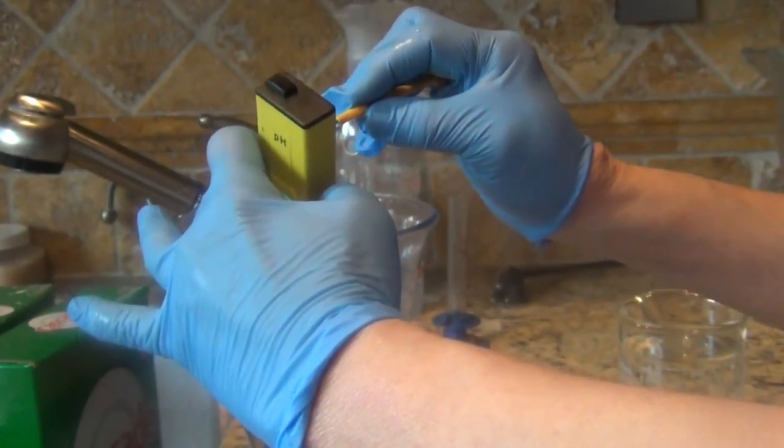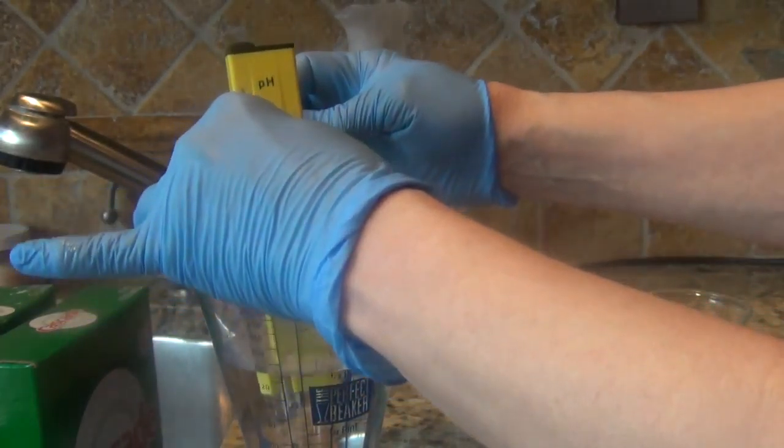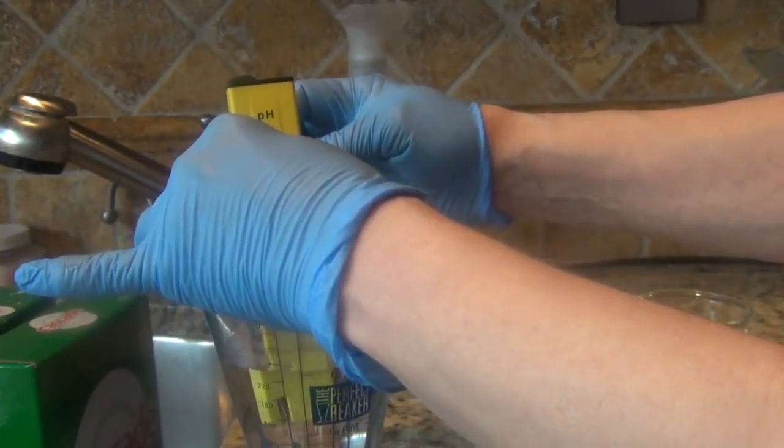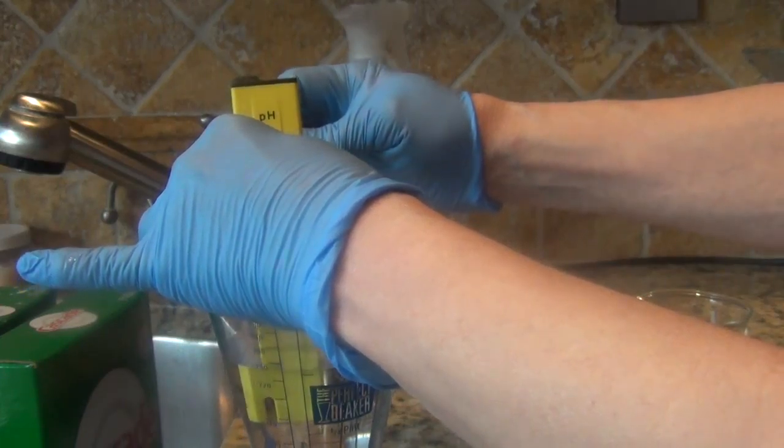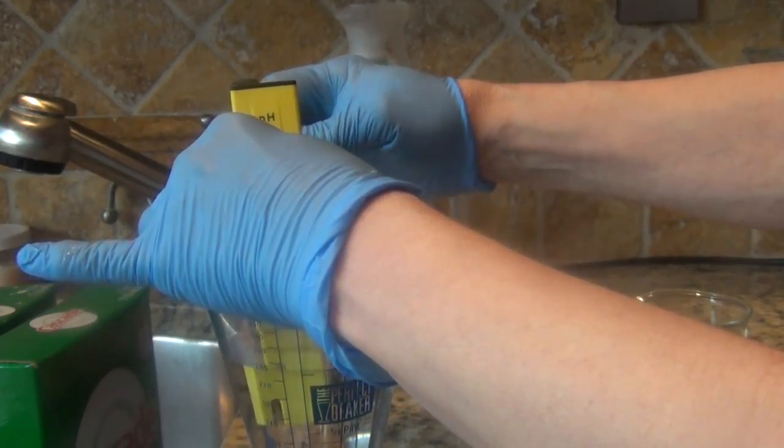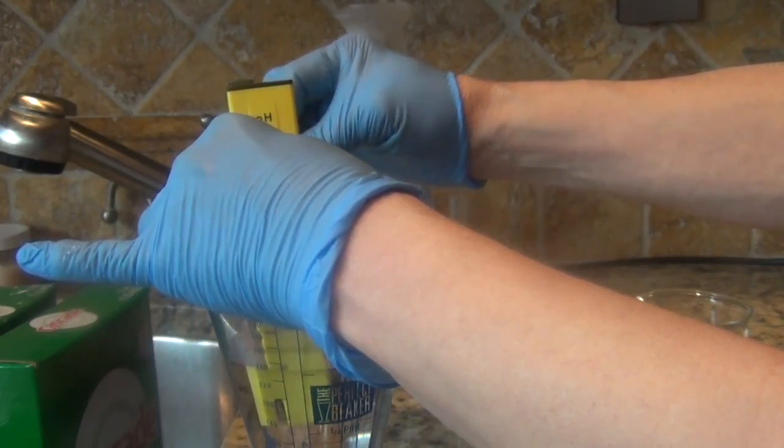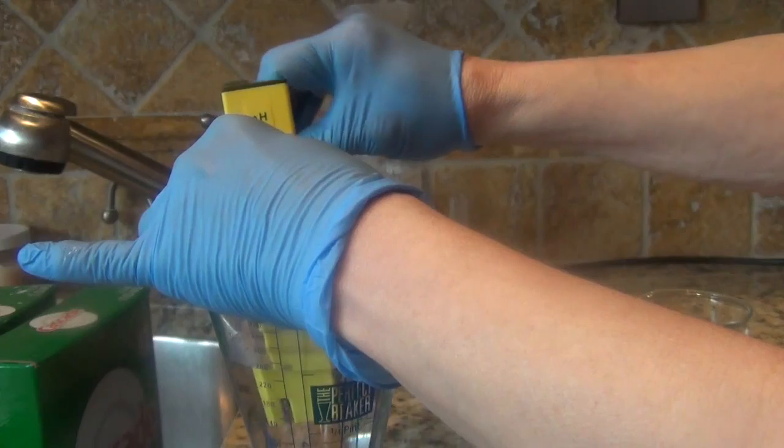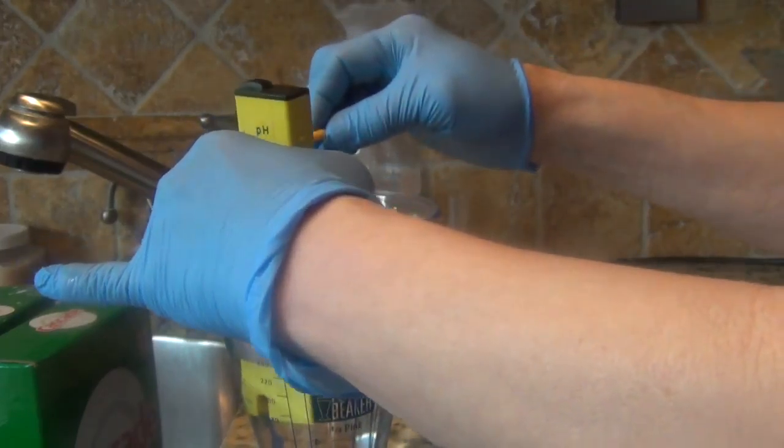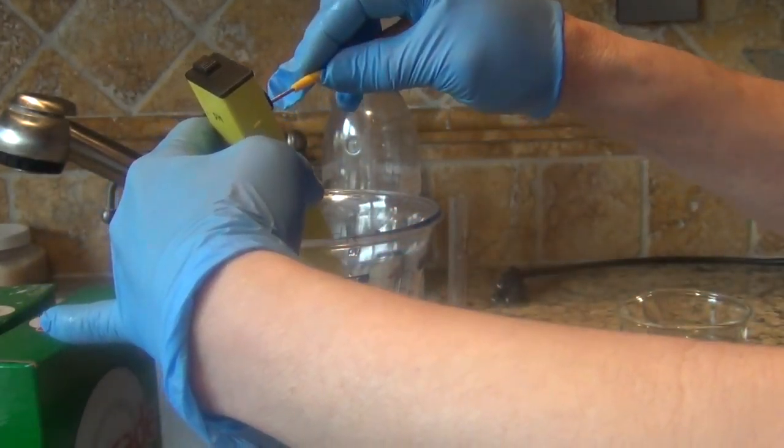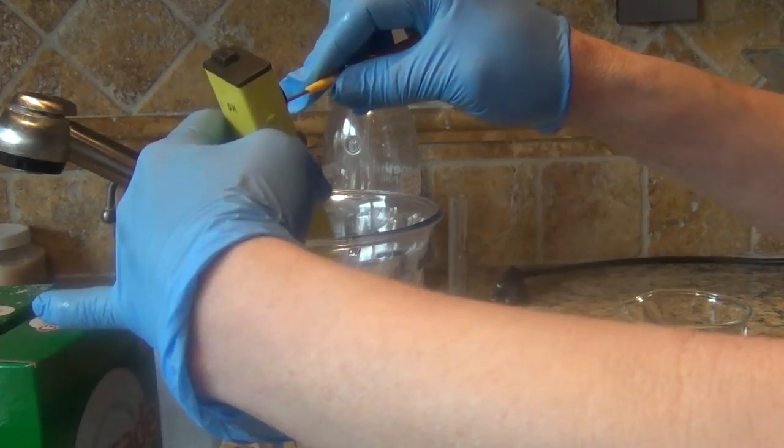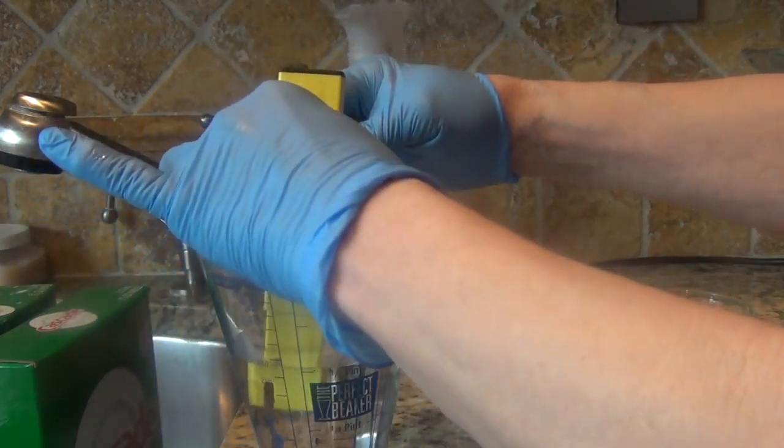I've broken so many of these it's ridiculous and I hate calibrating them so it would behoove me to not do the breakage. I've dropped them so many times. It really helps if you have someone else help you with this.